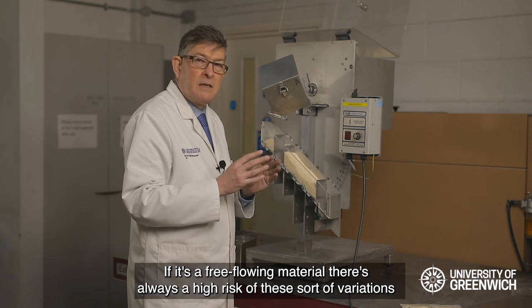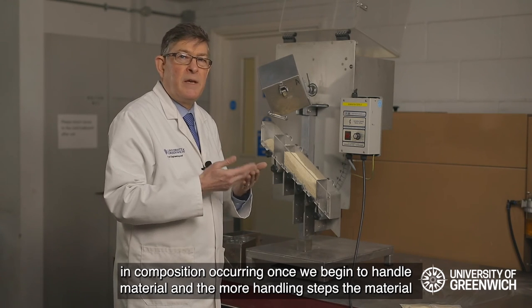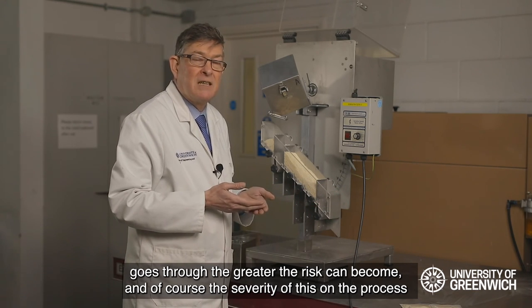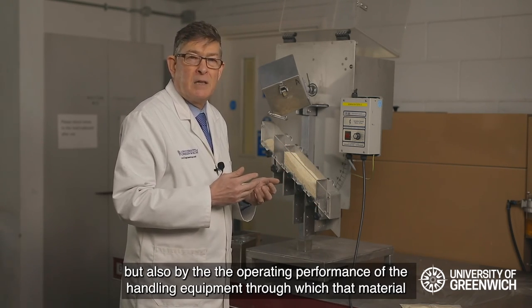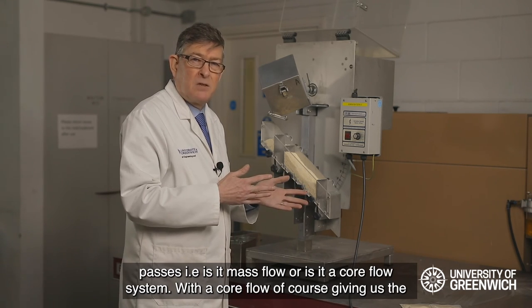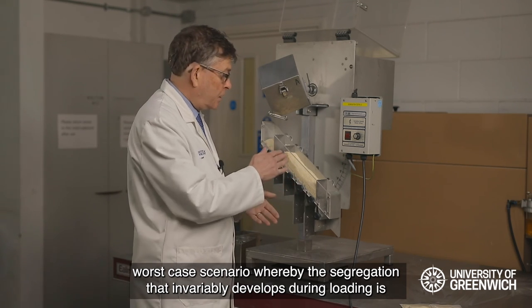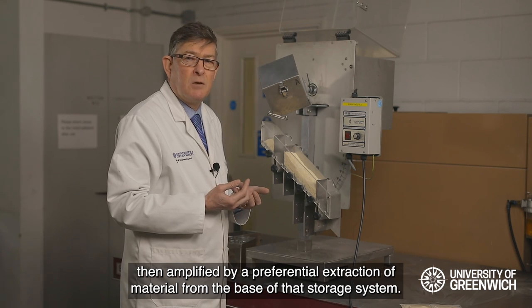If it's a free-flowing material, there's always a high risk of these variations in composition occurring once we begin to handle it, and the more handling steps the material goes through, the greater the risk can become. The severity of this on the process is dictated not only by the material characteristics obtained from this machine, but also by the operating performance of the handling equipment through which the material passes — i.e., whether it is a mass flow or a core flow system. Core flow gives the worst case scenario, whereby the segregation that develops during loading is then amplified by a preferential extraction of material from the base of the storage system.